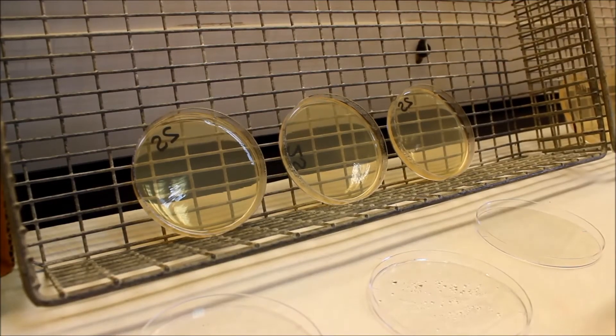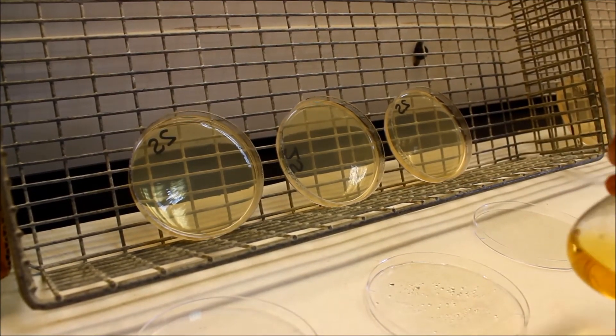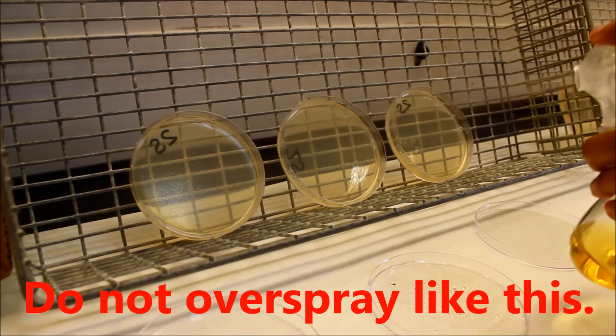This step is important. If you don't cover the complete surface, you will get breakthrough false positive colonies. Do not overspray and flood the plate.